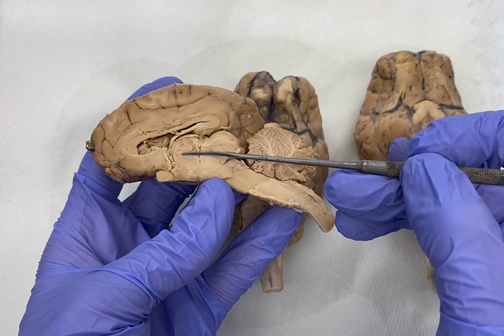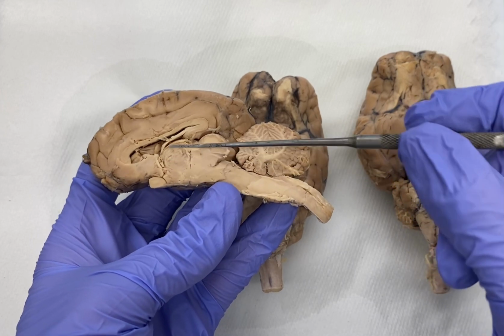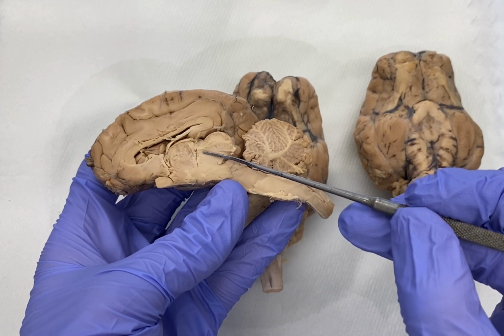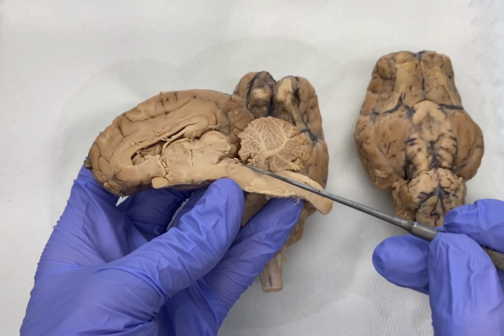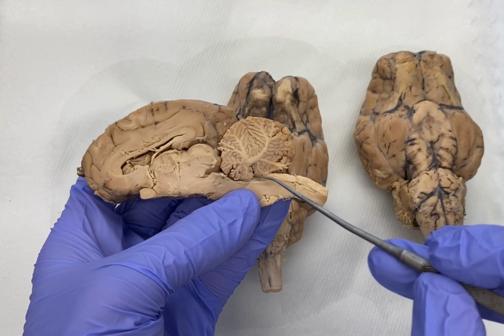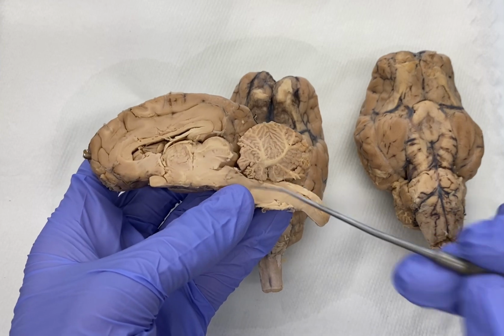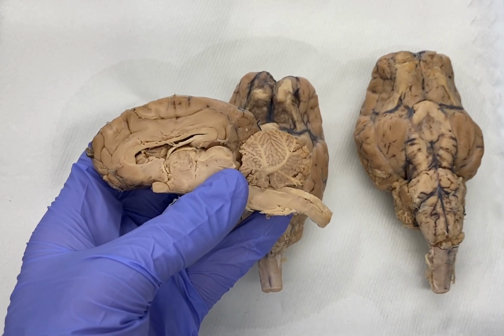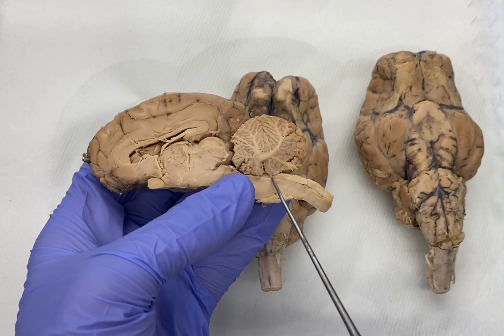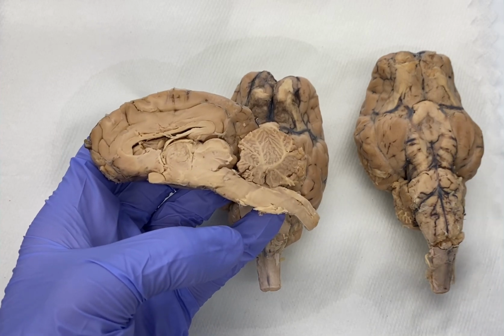From the third ventricle, there is a slender tube, a slender opening called the cerebral aqueduct, which extends from the third and extends down, passing kind of posterior to the brainstem, and it drains CSF into our fourth ventricle here. And then from the fourth ventricle, there are what are called apertures, a median and 2 lateral apertures, which extend medially and laterally to allow CSF to then enter into the subarachnoid space, right? Which again, I mentioned a second ago and said we'd come back to it.